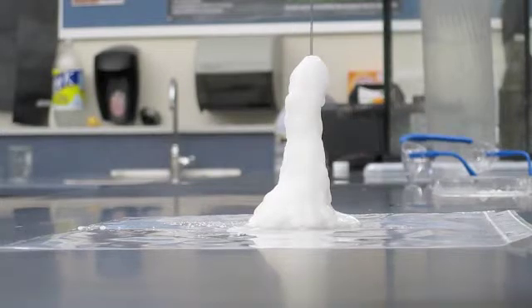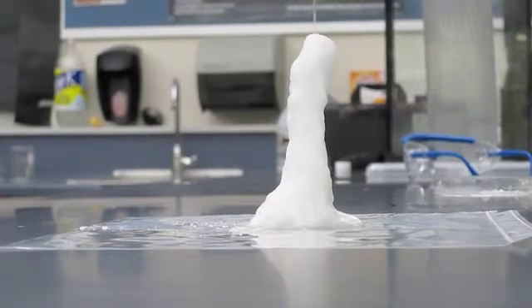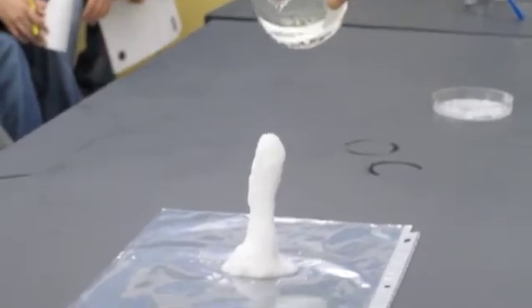So we can build up these columns. That's pretty, this is a great batch. You guys are lucky. I think only second, third period yesterday saw as good a batch. Now what's cool is I'm going to touch the beaker to the column.